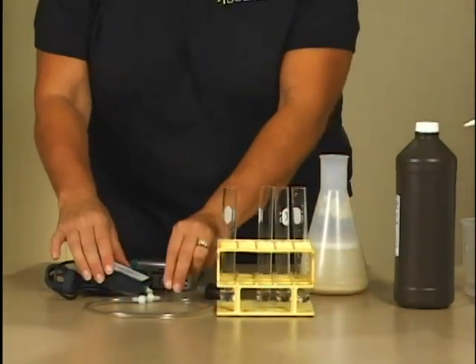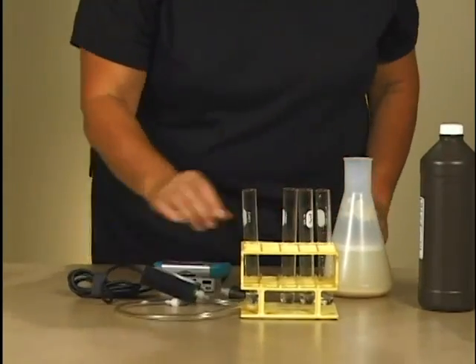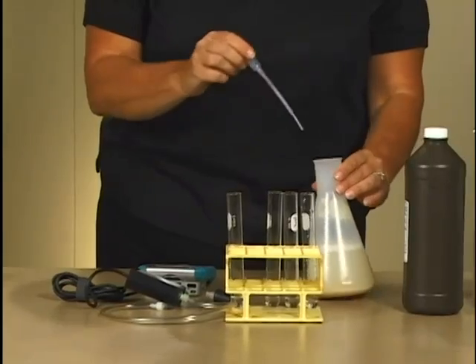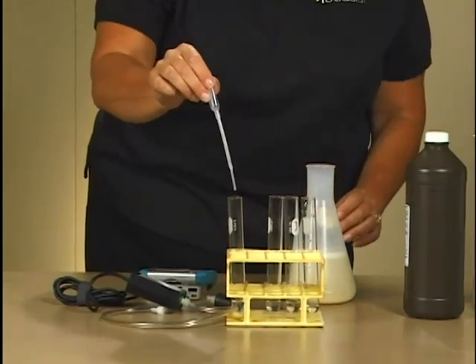Connect the plastic tubing to the gas pressure sensor with a gentle half turn. Place one drop of the enzyme solution into test tube one.